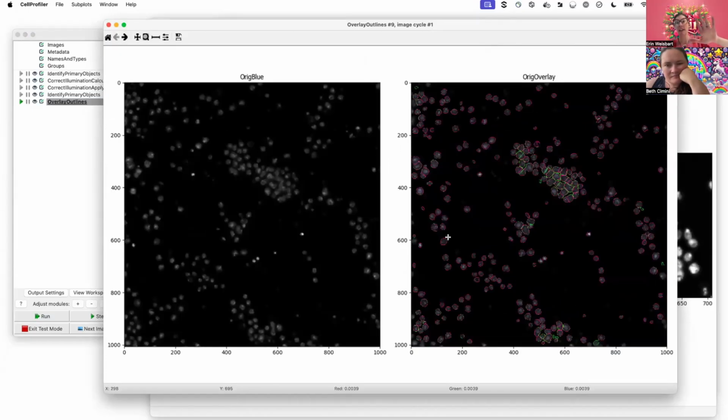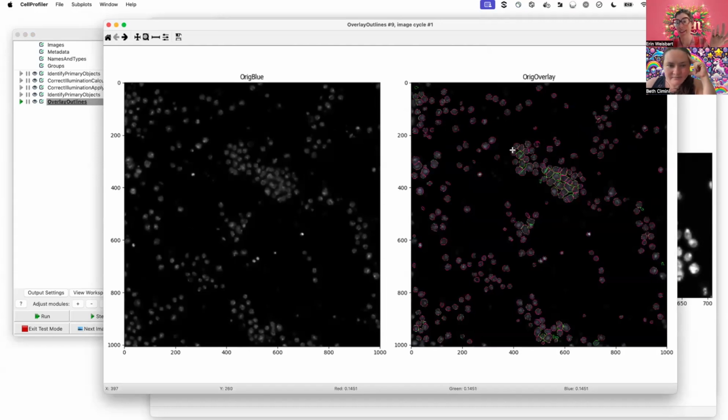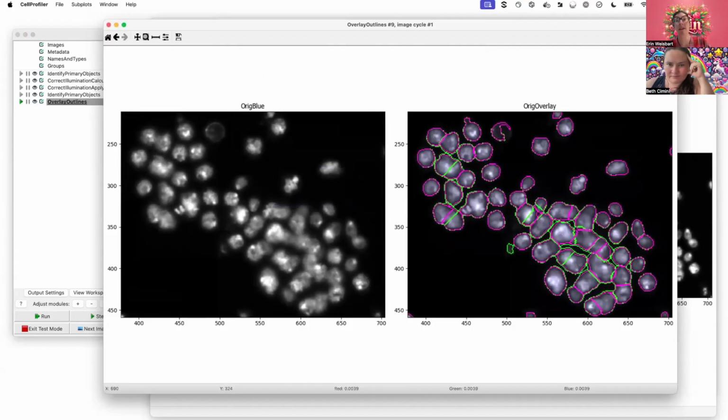So in most of the nuclei, it's exactly the same. Maybe here they're off by a pixel, where if I only see pink on the edge, it's the same. But here where they're different, I can look and say, okay, I'm seeing that these are different. If I scale up this brightness a bit, I actually mostly like what's happening in the pink better. Here, I think this one was divided in two in green, and I think that should be a single object. Likewise, this one was divided in two, and I think that should be a single object.